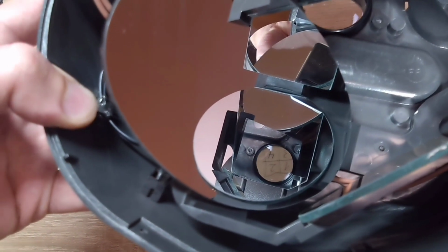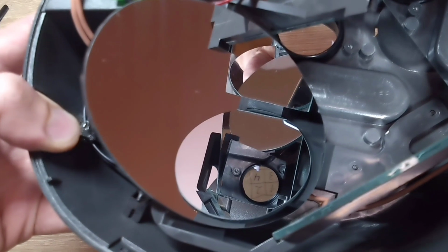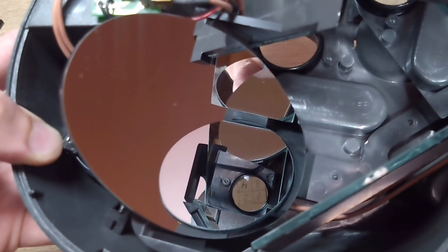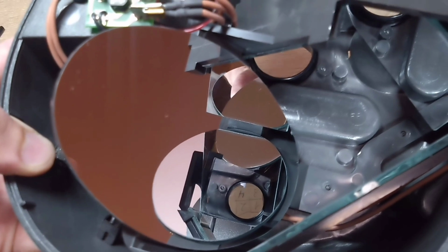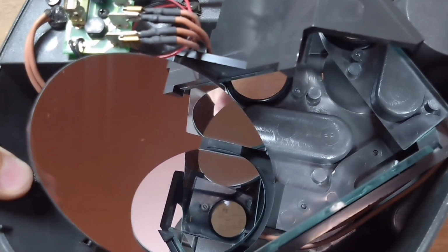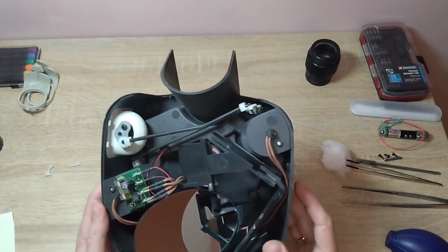If you take just a group of mirrors, you see the image is inverted. So, first the objective inverts the image once, and then the group of mirrors inverts it again, and the image becomes correctly oriented again.